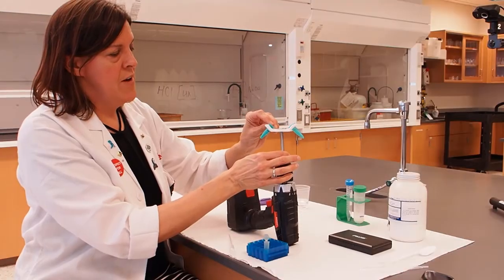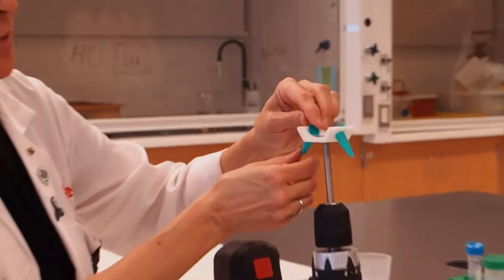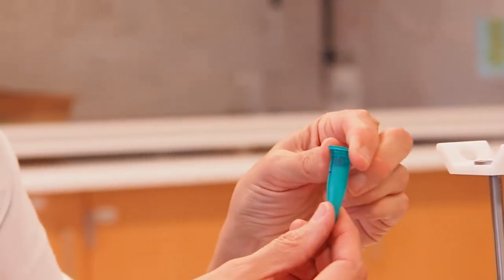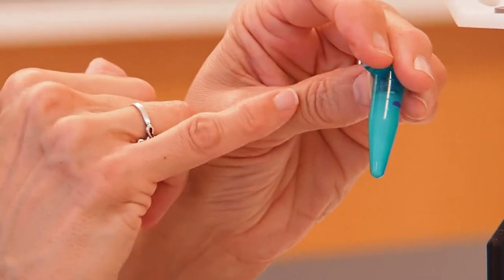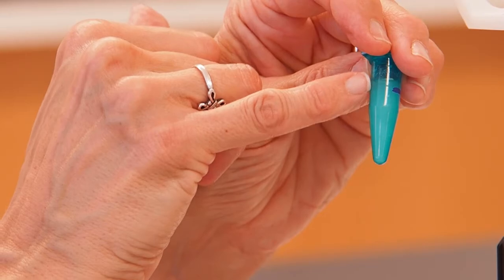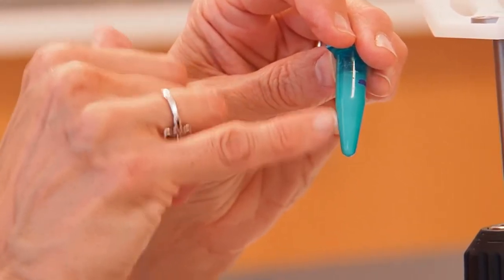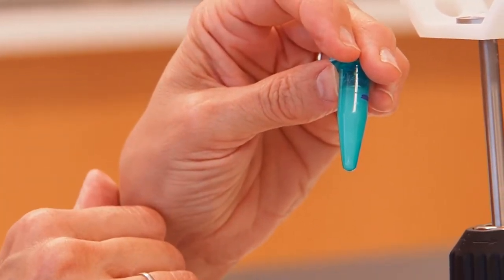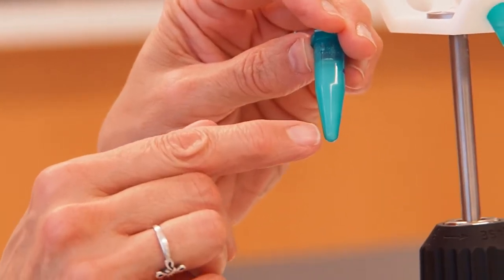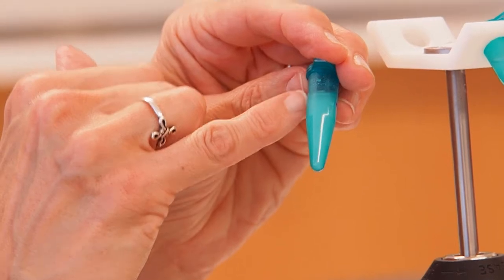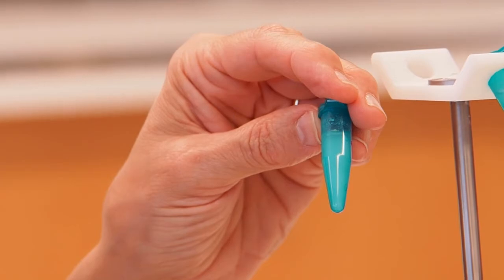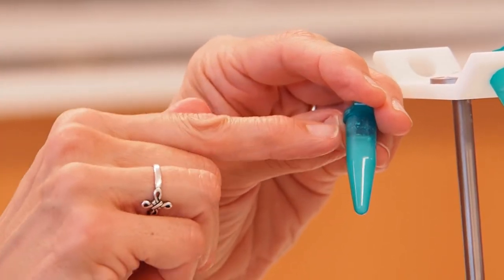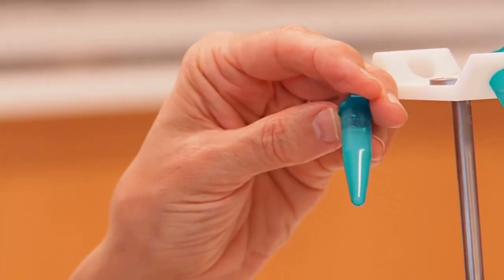Our minute is up. I'm going to very carefully, without shaking my tube, remove the sample from the sample holder. What you should see is on top there is clear liquid or a clear colored liquid, and on the bottom you'll see a cloudy precipitate. The bottom that's cloudy we call the pellet, and the fluid that's up at the top we call the supernatant fluid. Just like Superman or a superhero flies over a city, the supernatant fluid is lying on top of or flying over the pellet.